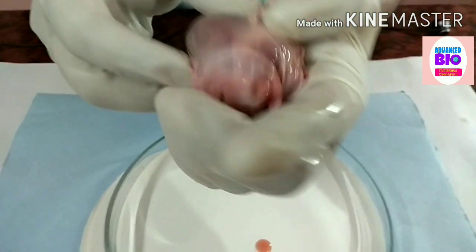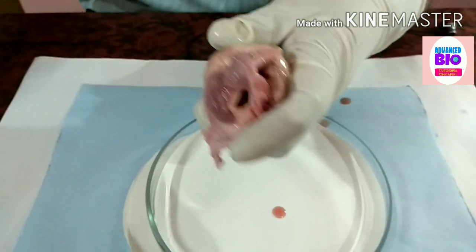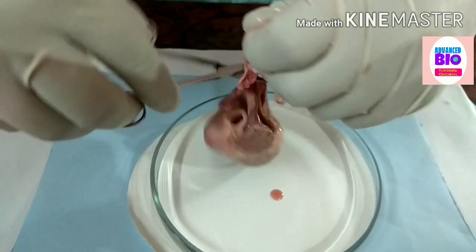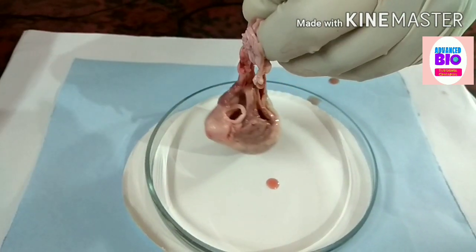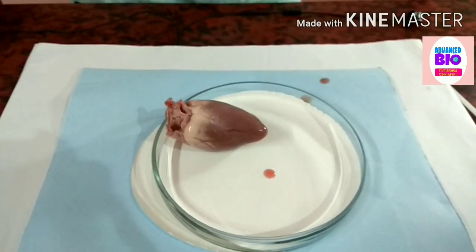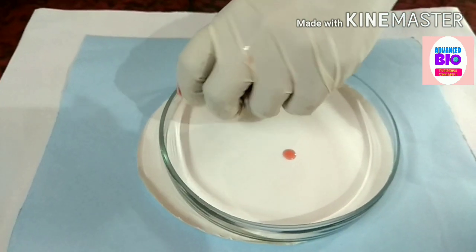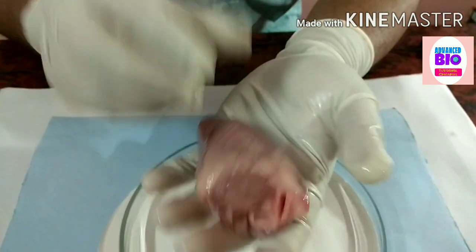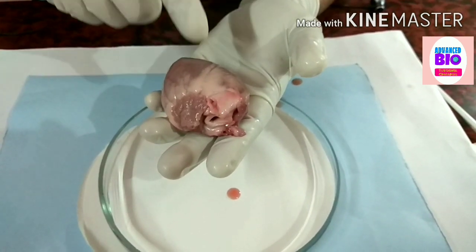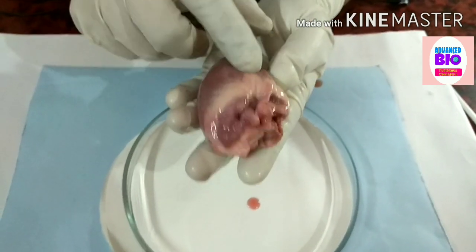Now see the pericardium — let's cut it out. Now see, this is the heart. Firstly we determine the orientation.